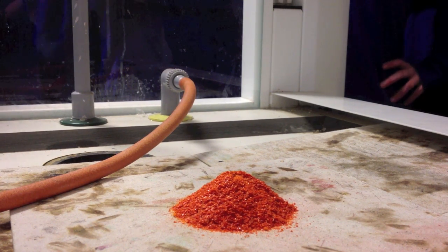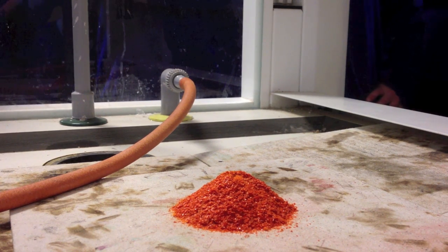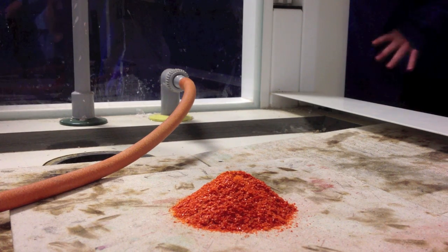Now, I need to get this really hot and then I'm going to stab it into the middle of the orange stuff, and that should get it going. It looks pretty hot but I need it really, really hot. It's nearly there.